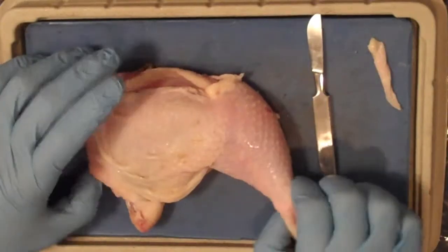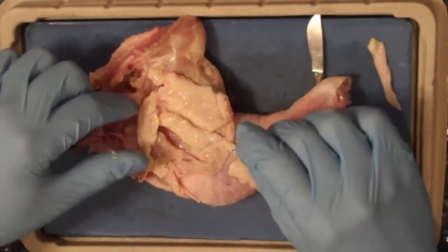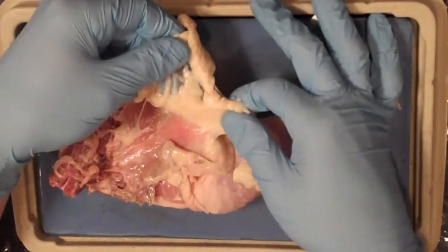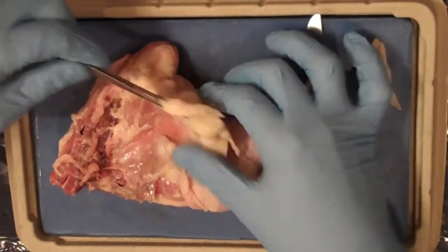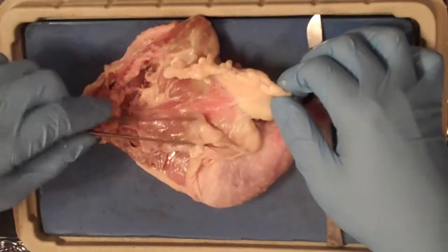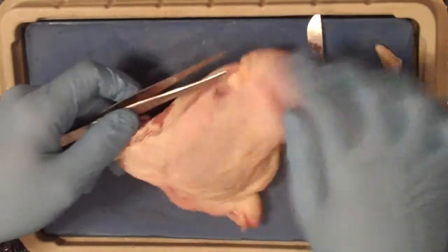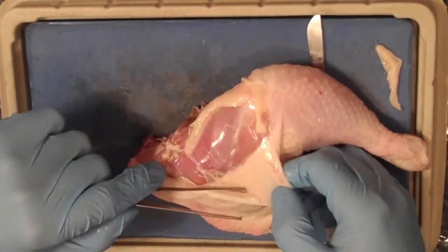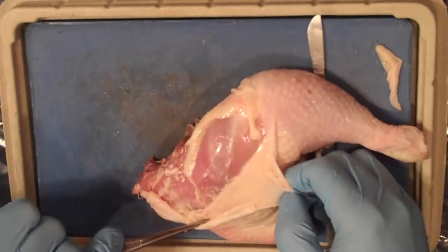So the next thing you want to do is flip your chicken over. This will expose a number of other tissues. On this side of the chicken, the first tissue that we'll be looking at is adipose tissue. Adipose tissue is yellow, it's stretchy, it's spongy. You should find it in clumps all over the underside of the chicken. Also, if you lift up the skin, you should be able to find some adipose tissue lining the underside of the skin. This provides nutrient storage in the form of fat and also provides thermal protection when the weather gets cold for the chicken. Humans have adipose tissue lining the underside of their skin as well.